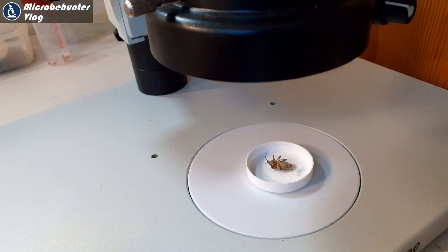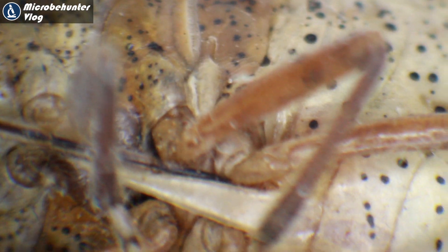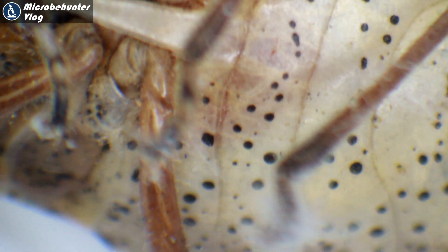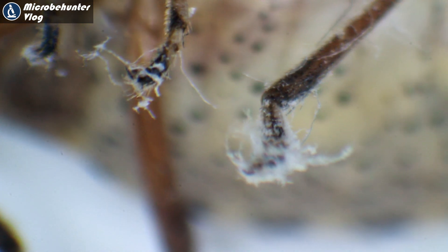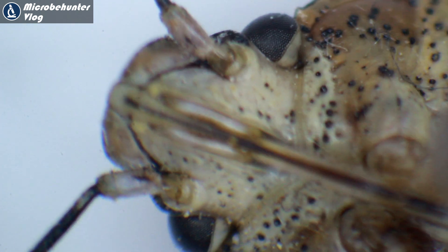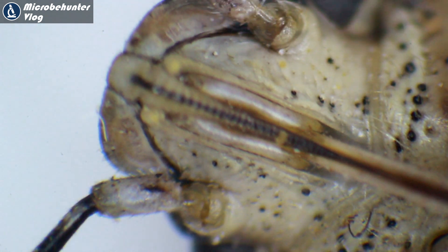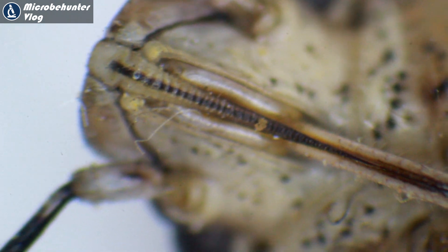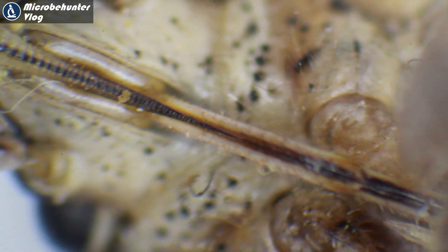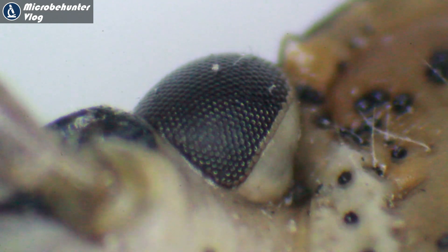With the help of my stereo microscope we can actually find out a little bit more about their true nature. This is very clearly a bug and not a beetle — the reason is the mouth parts. Here are the legs, but the mouth parts in a bug have no mandibles, no jaw. Zooming into the head, we see a long trunk extending from left to right, which is very typical for bugs. Beetles, by contrast, have jaws — mandibles — that are able to carry food.